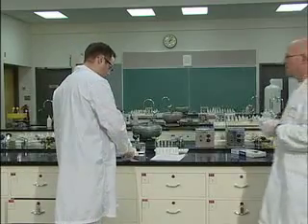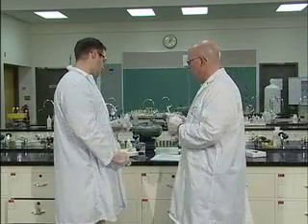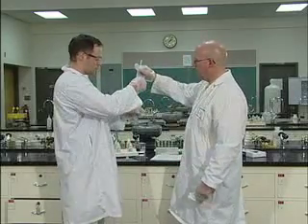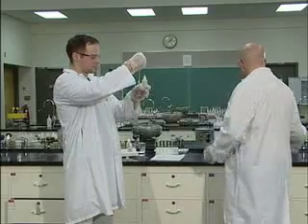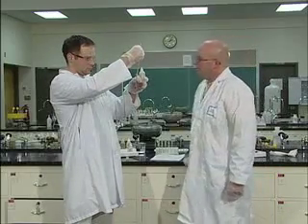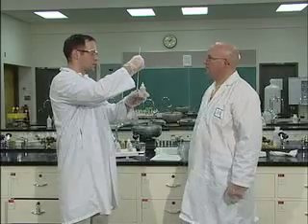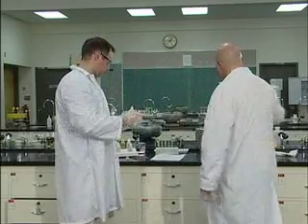We're going to test the temperature first? I don't think we need to. Oh, we don't have to. No, we do need to test the temperature. I bet you it's going to be roughly 25 degrees. I'll bet it is. Because it's room temperature. And it is roughly 25 degrees. All right, good. I'll take care of it.